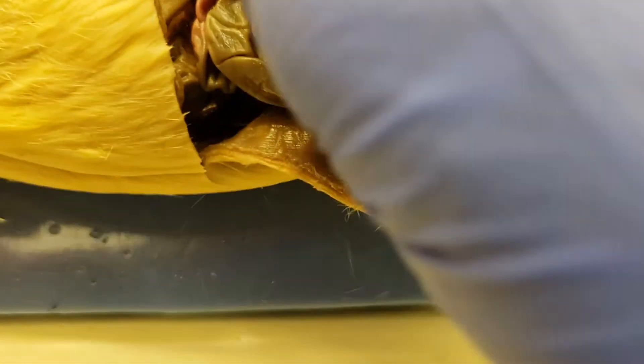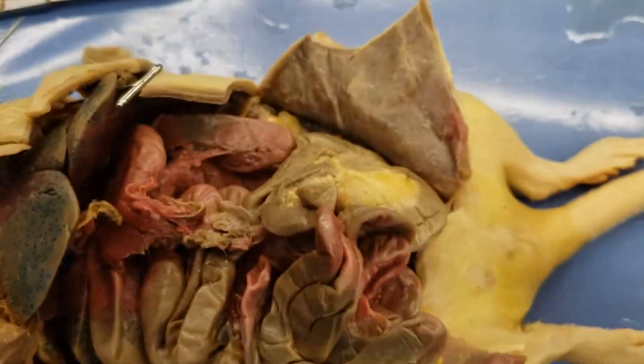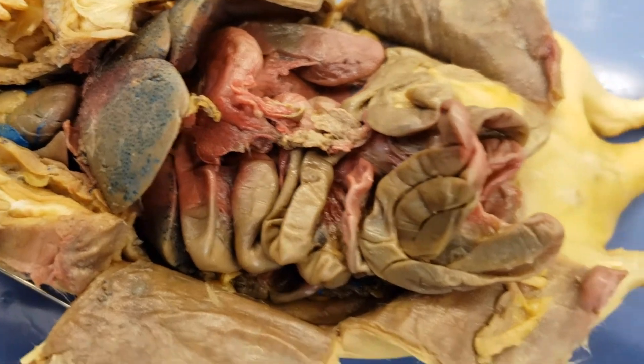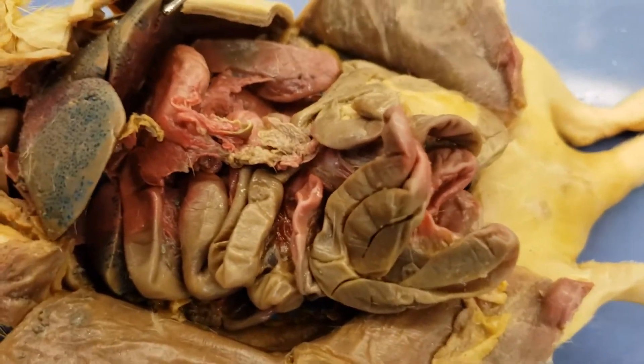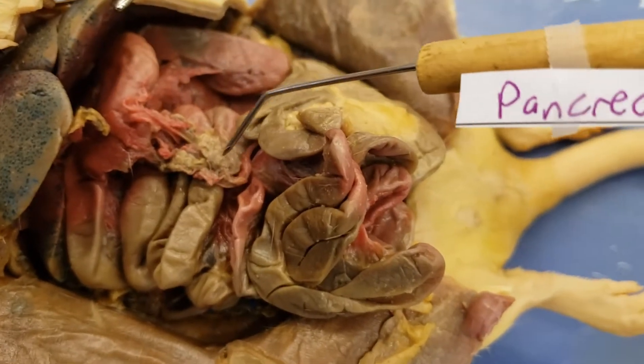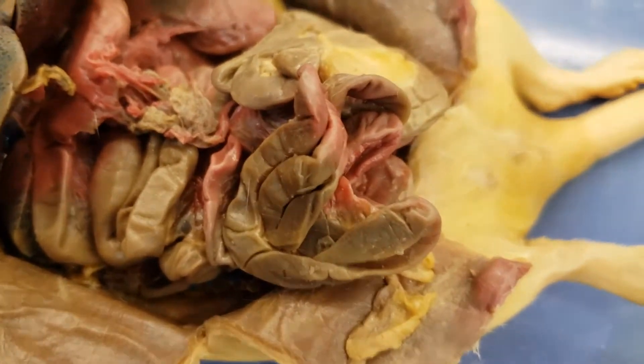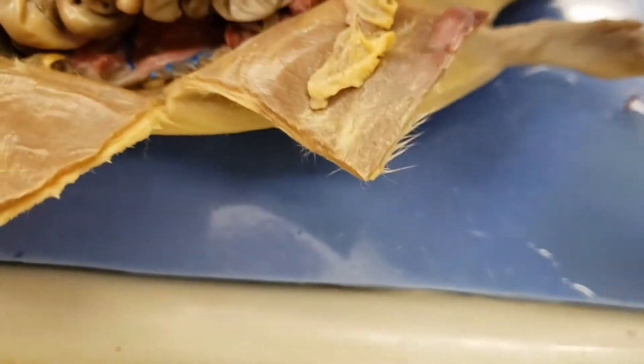Next up is the pancreas. The pancreas is a real thing but it's a tricky one. Sometimes it's easier to spot and it's like, boom, there it is — amazing-looking pancreas. Other times it can be indecipherable from fatty connective tissue. My suspicion is the pancreas is part of this torn-up tissue here; it does not preserve well. So I've got some other pictures from a pig dissection I'll throw in there to represent a pancreas, because it's a really good-looking pancreas. You'll get a good picture of it before the day is done.